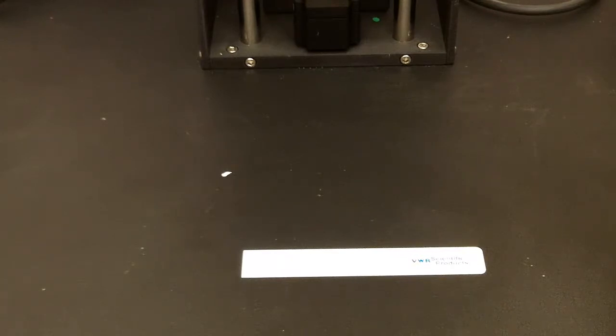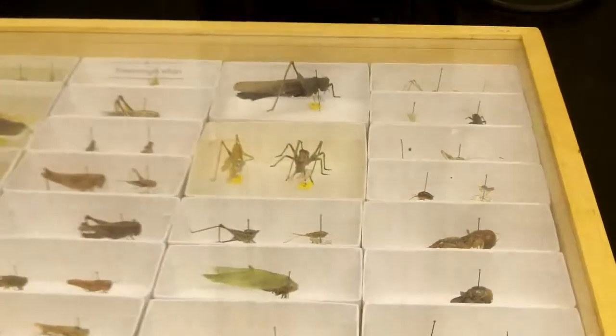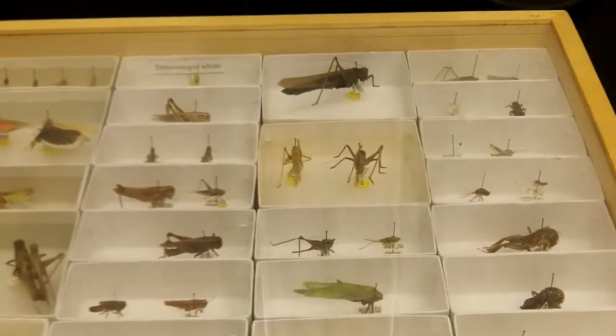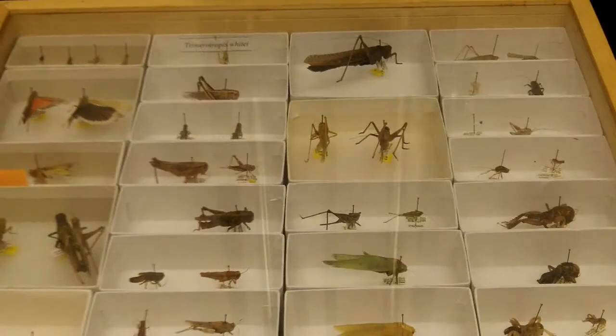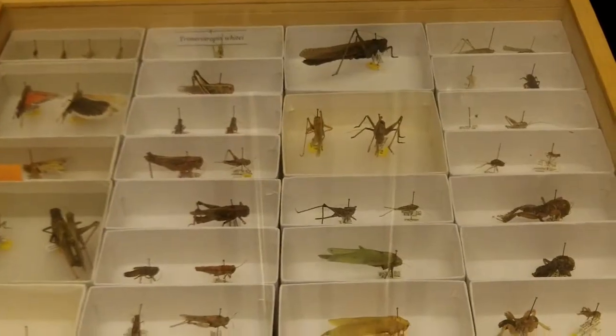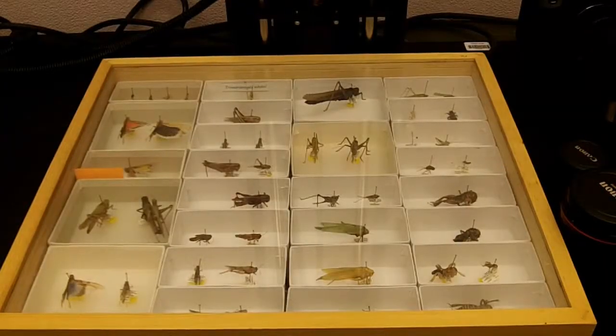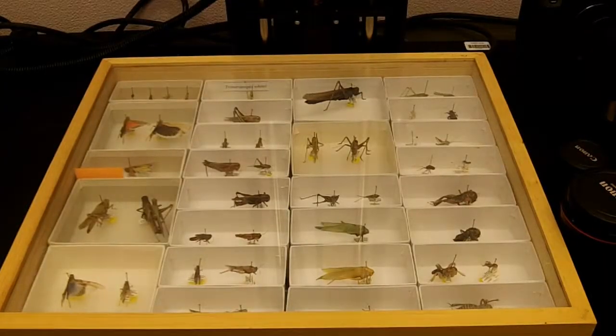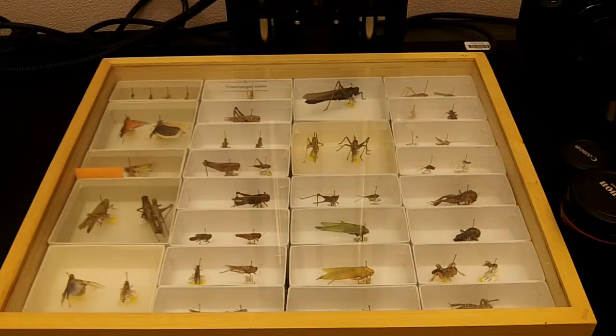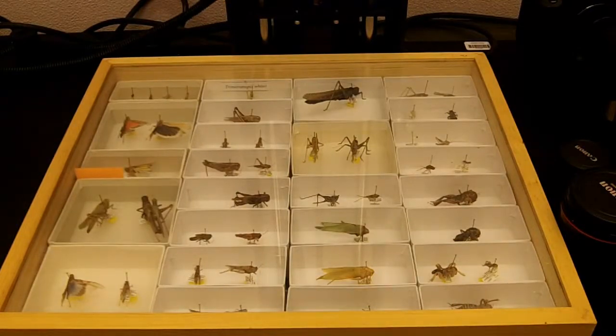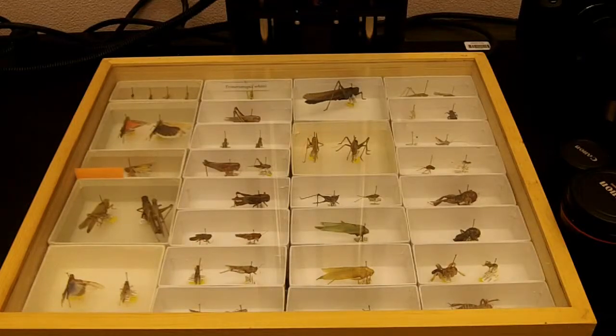So, now, let's go over how to tell which type of lens you should use for the size of the specimen you have. So, here is an entire drawer of specimens. Several dozen of them. And this is a very large image to take. So, the best lens to use, in my experience, is the 35mm.